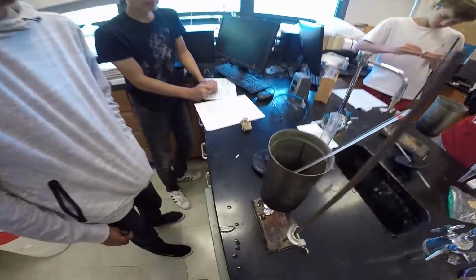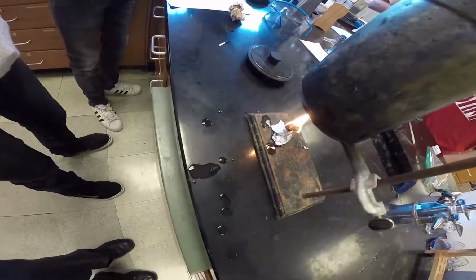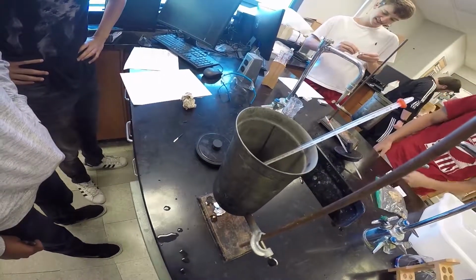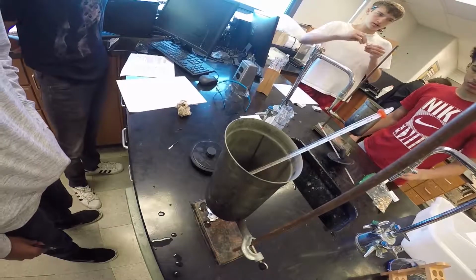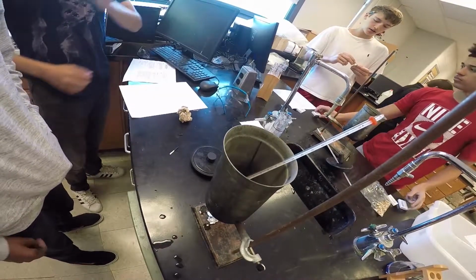Excellent. Did you measure the initial temperature? Yeah. Good. See how it's increasing the temperature? What was your initial temperature? 23. Looks like you're at 25 right now. 26. It's like you're 27.